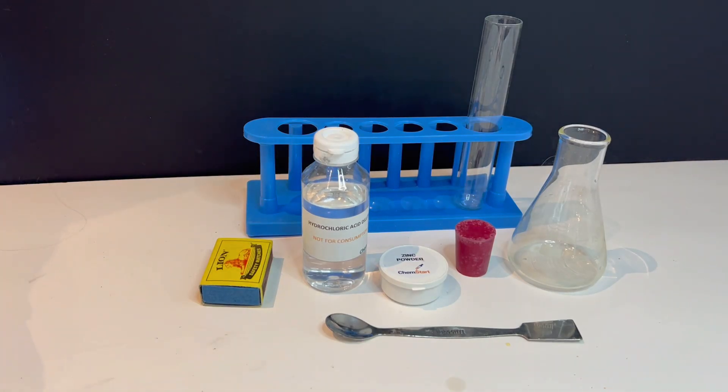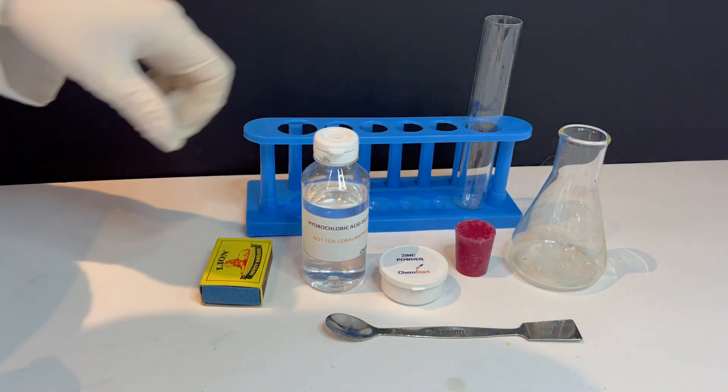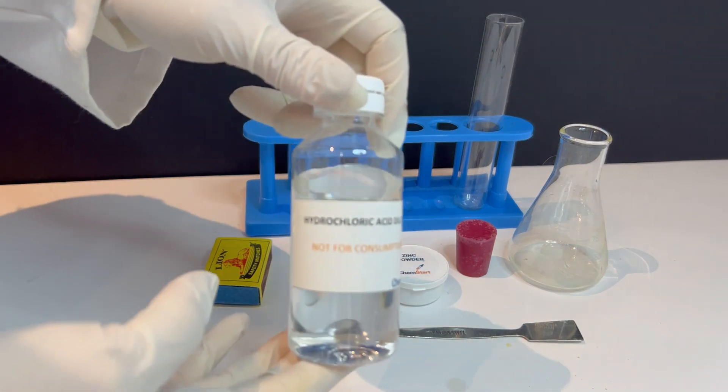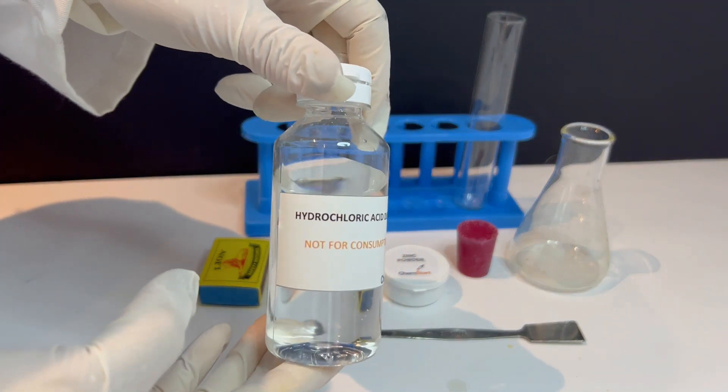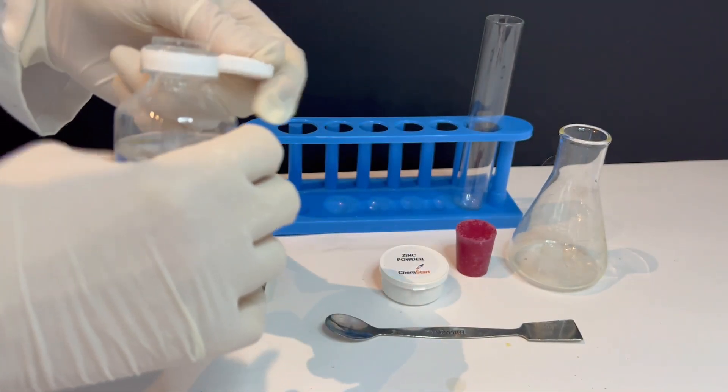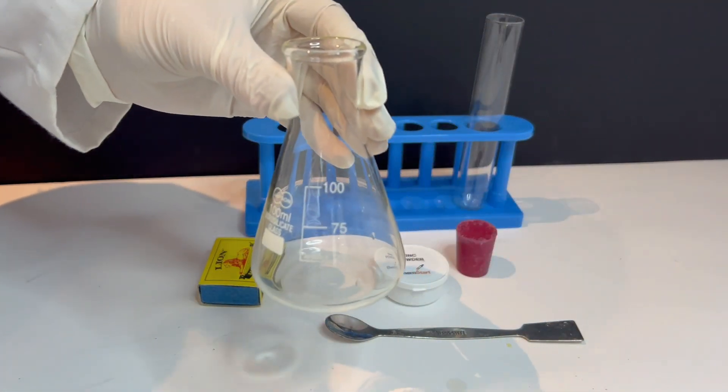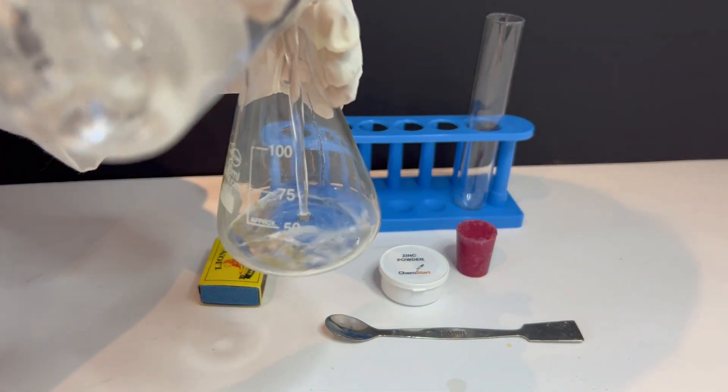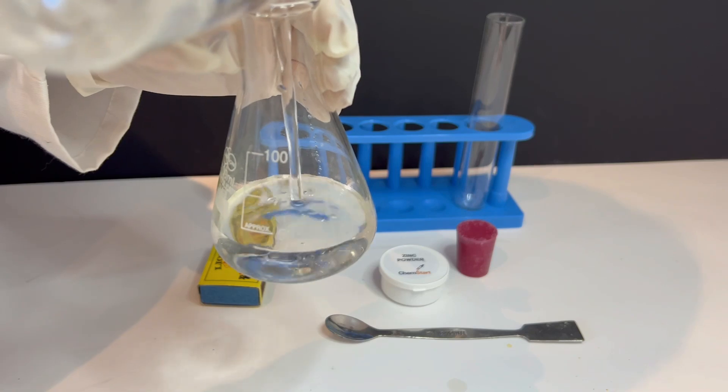We are going to observe a chemical reaction between zinc powder and dilute hydrochloric acid, and we'll test the gas that forms during the reaction. Let's find out what happens when these two substances react.